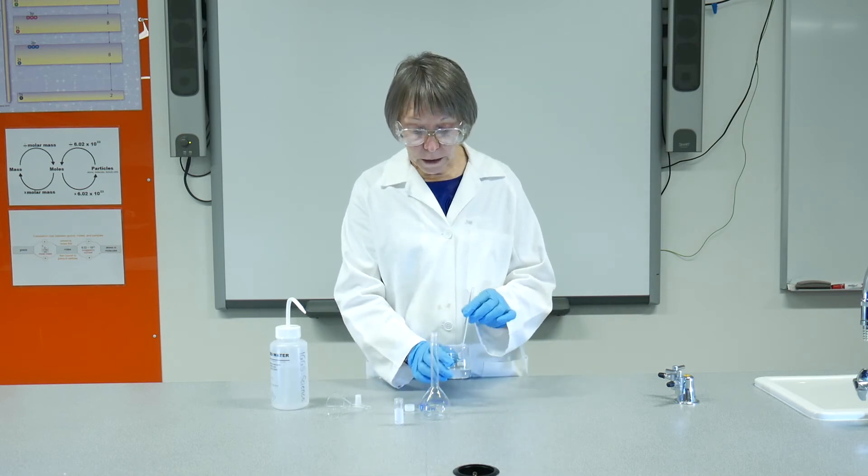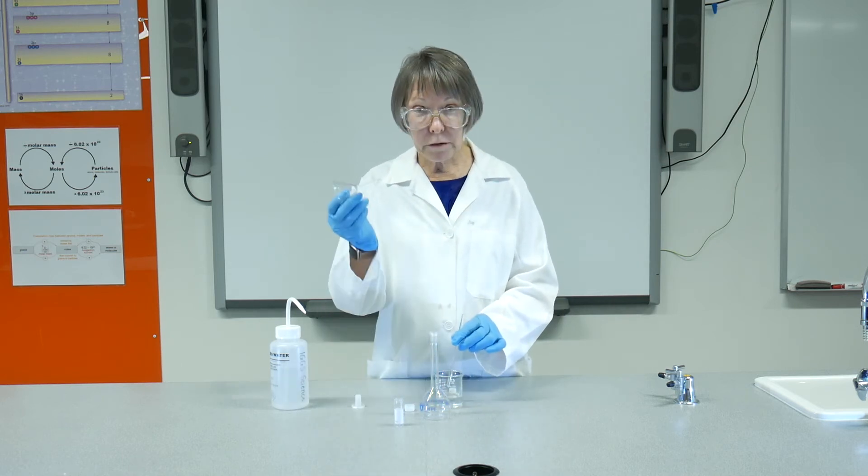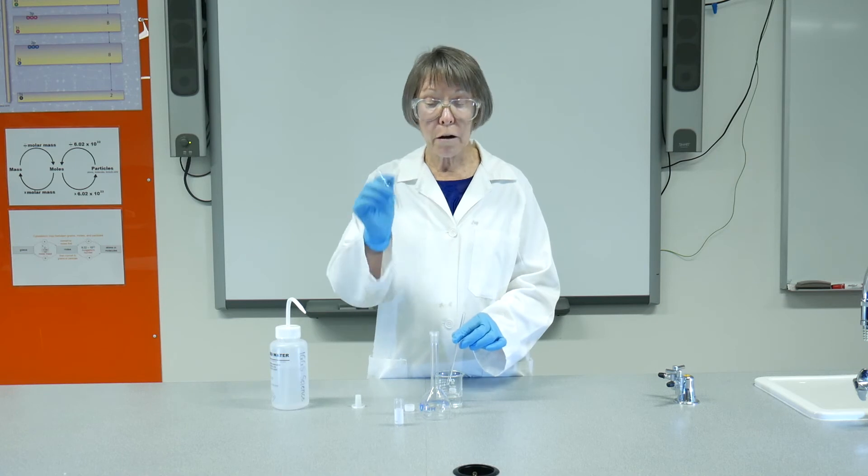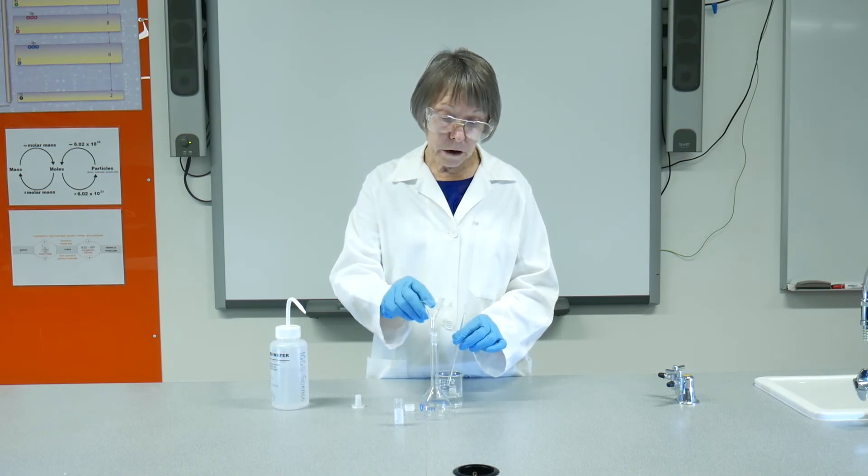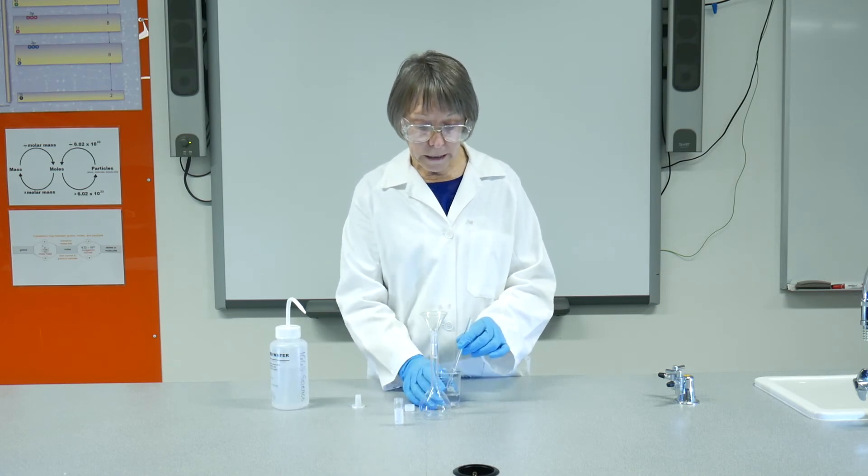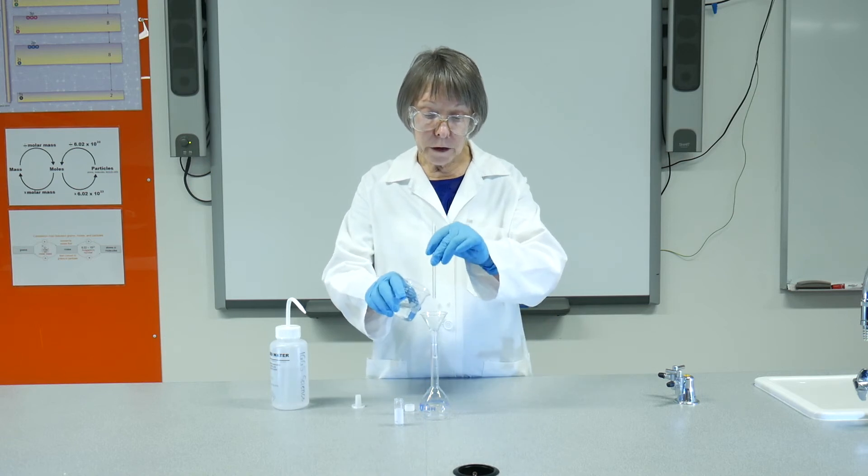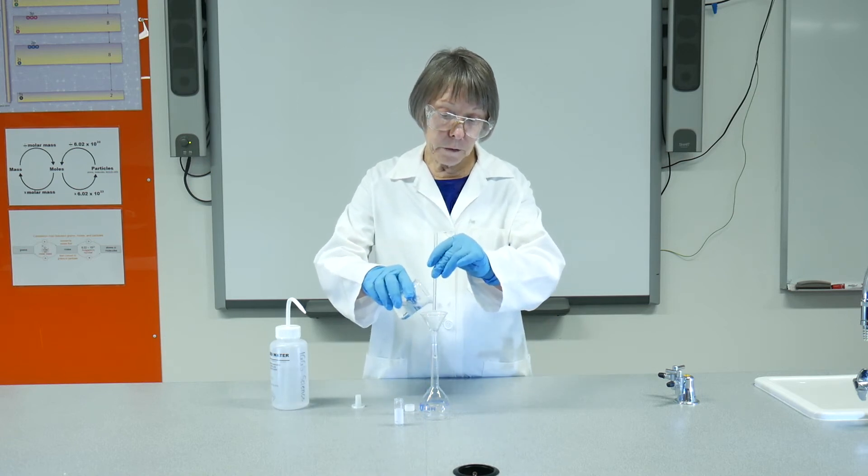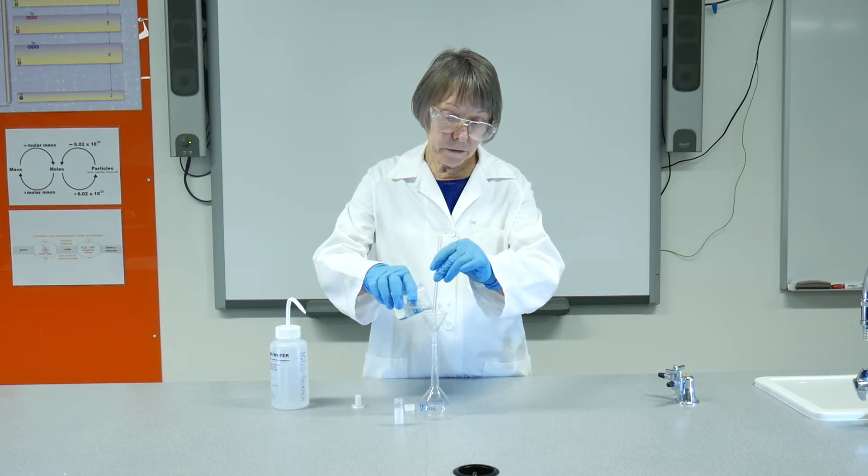Now that my acid has completely dissolved, I'm going to transfer it to the volumetric flask. Now I've rinsed my funnel with DI water. I'm going to place it in there, and we're going to pour this into the flask.